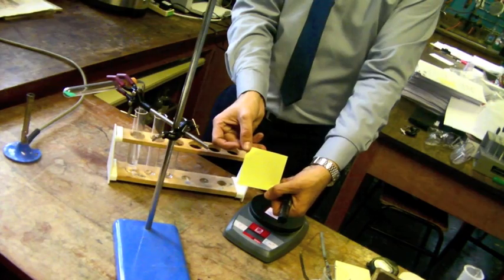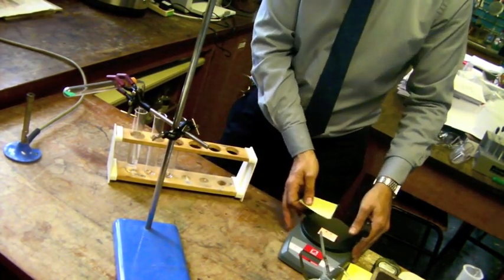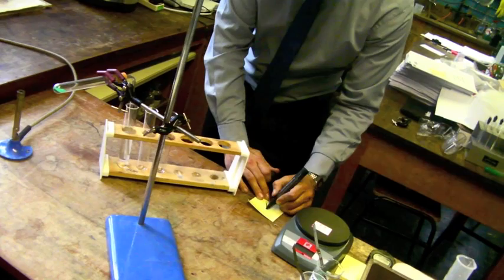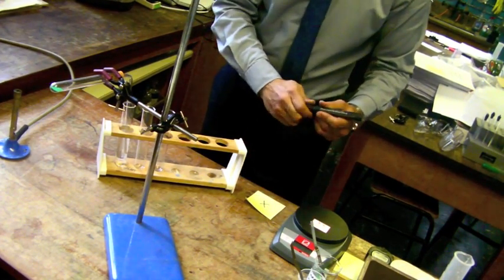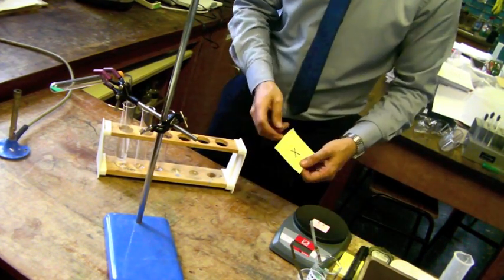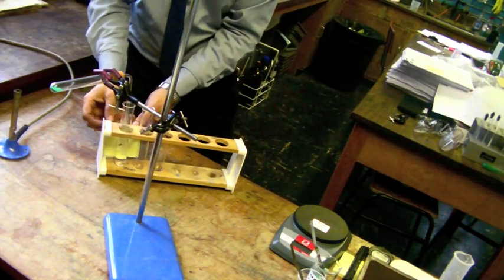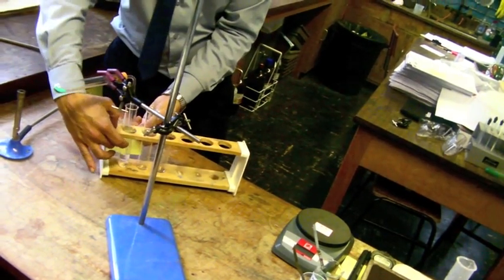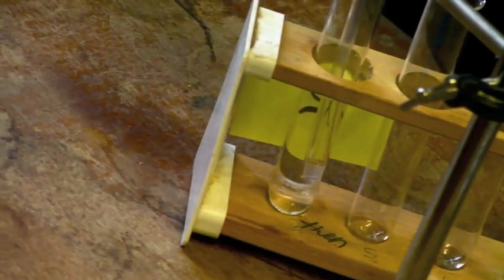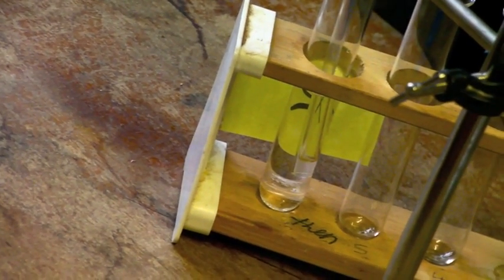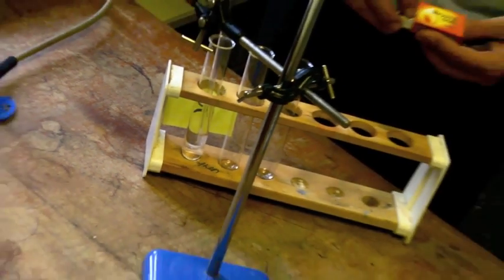Get your sticky note and using your marker pen, carefully draw a black cross. Place the black cross behind the boiling tube containing lime water. The black cross should be visible through the lime water.